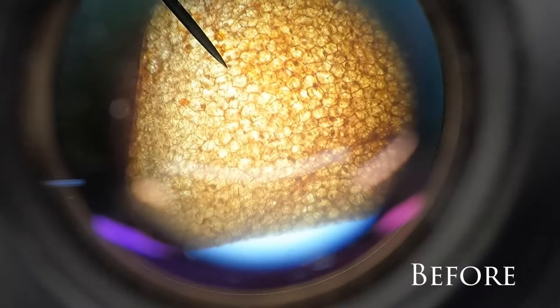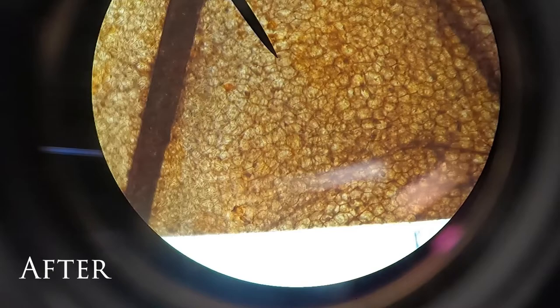If at this point your image is still not sharp, you can focus using the fine adjustment knob.